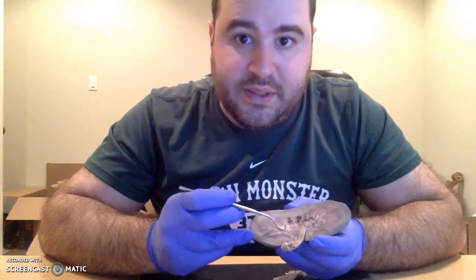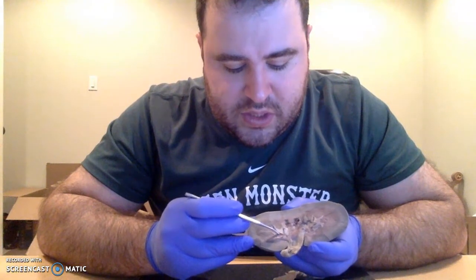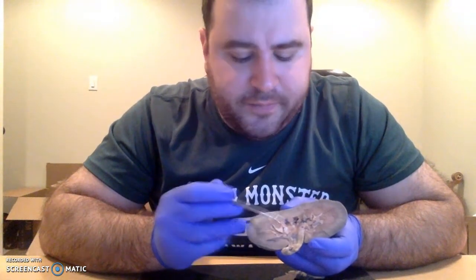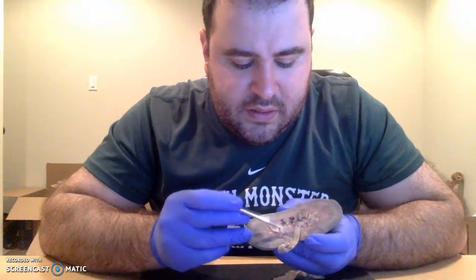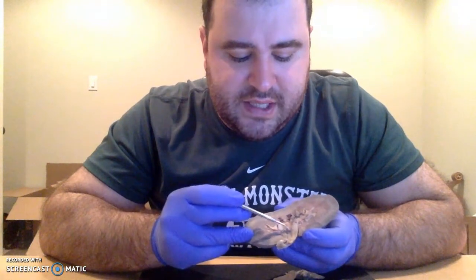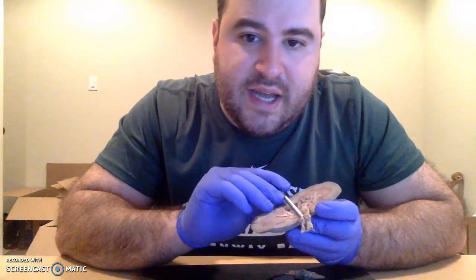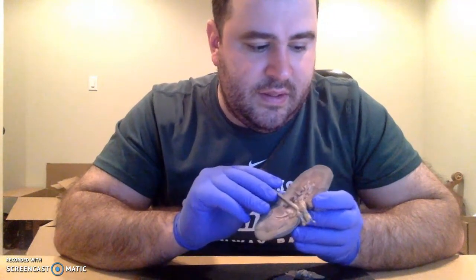And when the canal is wide enough, we get these minor calyces, which then funnel the urine into major calyces, like this one that I excised right here, which will finally dump the urine into the renal pelvis, which is the common collecting place for all of the calyces and ducts, until it finally trickles out the ureter. Fortunately, they left me a little piece of it attached. It comes out right there, as you can see.